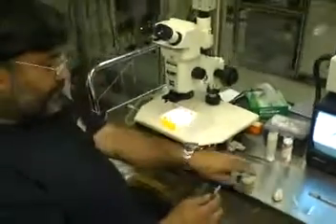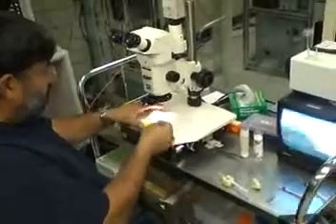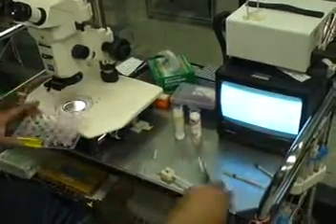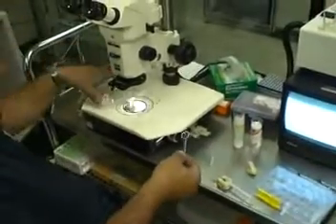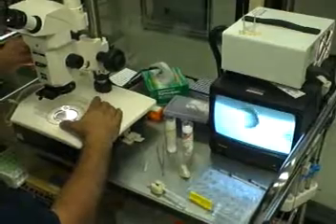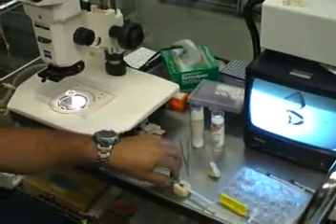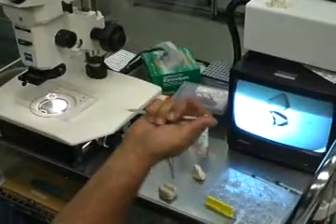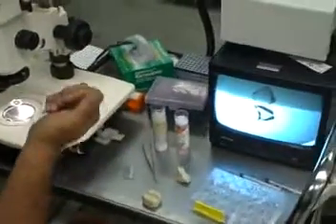I'm going to go now and fish the crystal, so I have to have all my tools ready. I'm going to remove the crystal gently and put it on top of a plastic cover. I'm going to locate the crystal again — don't try to fish one or two pieces out of that drop. To start, I position the syringe about halfway so I have enough play. I don't want to start at the bottom or the top but rather in the middle. Now we're going to put it in the microscope.